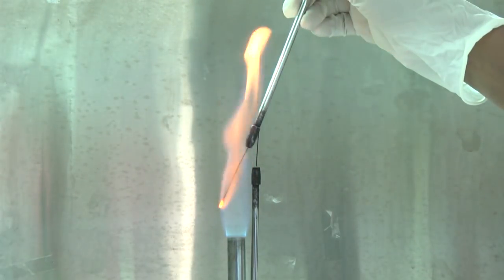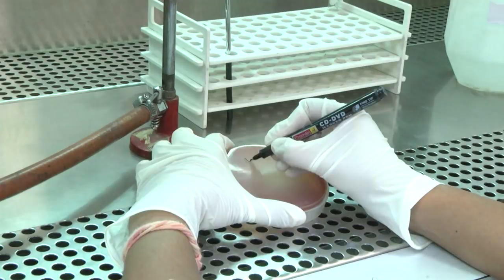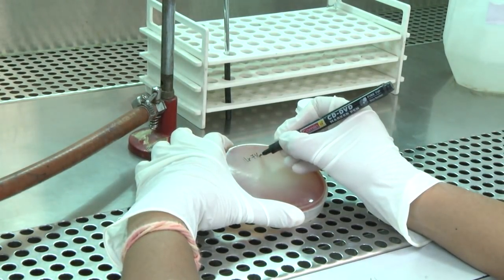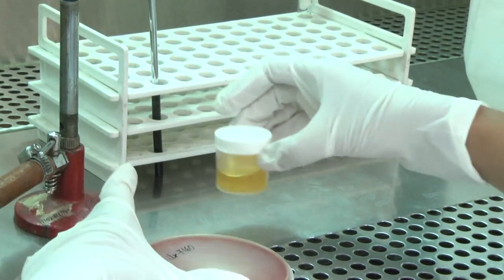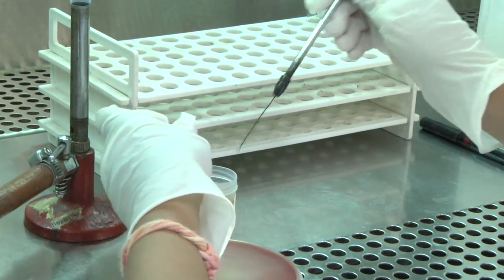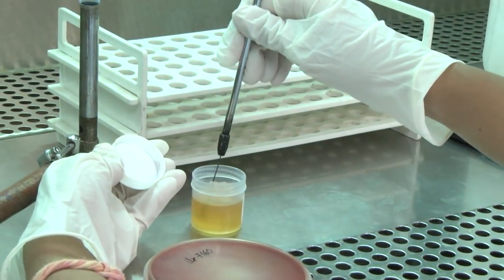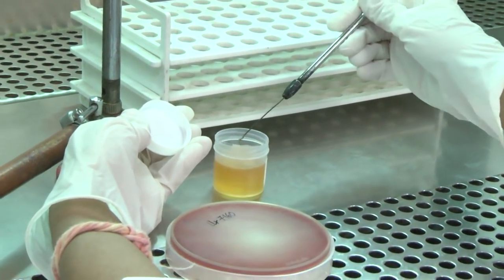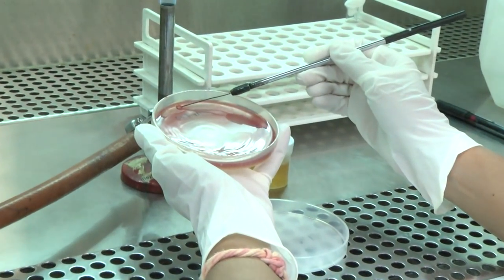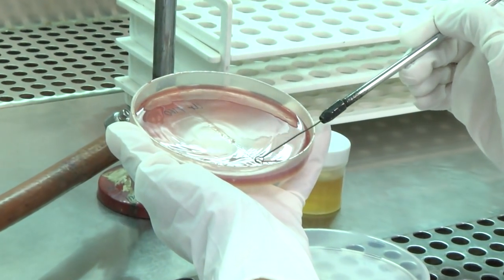Method: Flame a calibrated wire inoculating loop and allow it to cool down. Label the base of plates which need to be inoculated. Mix the urine thoroughly and remove the top of the container. Insert the loop vertically into the urine, allowing the urine to adhere to the loop. Spread the loop full of urine in a straight line onto the middle of the plate.